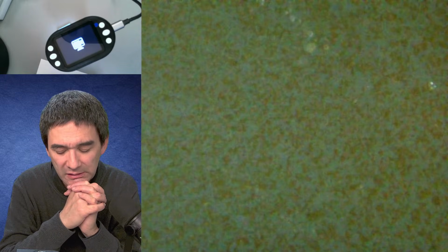I'm occasionally reading the question. Yeah. It's not directly comparable between a microscope with light from below and the other one with light from above. Yes, that's correct, because the light comes from above and is reflected by a little reflective disc. Yeah, yeah. So yes, yeah.